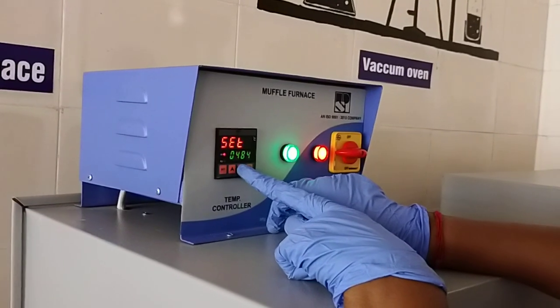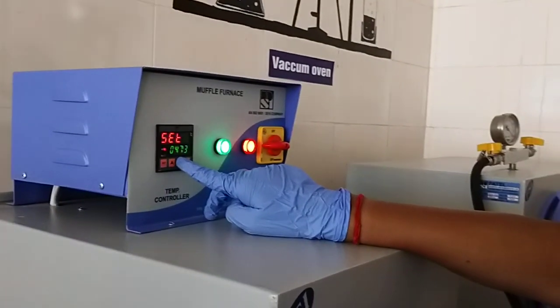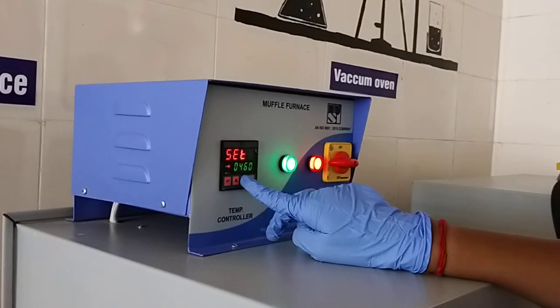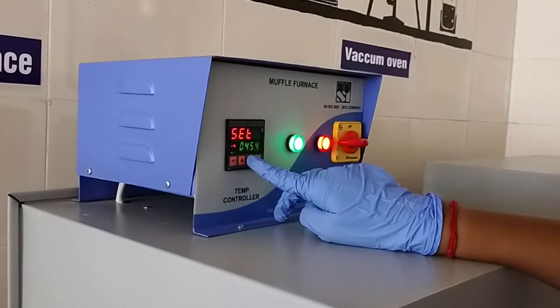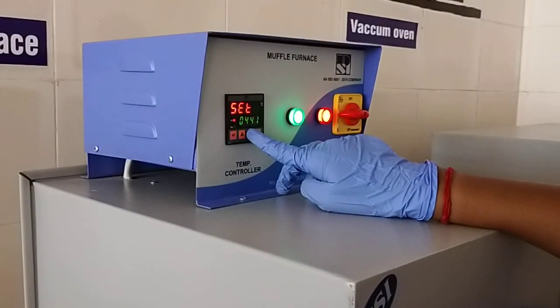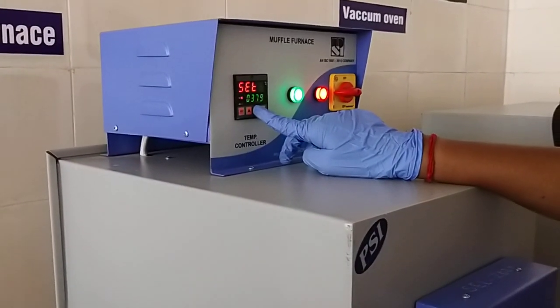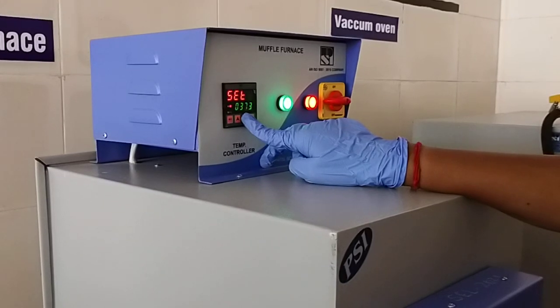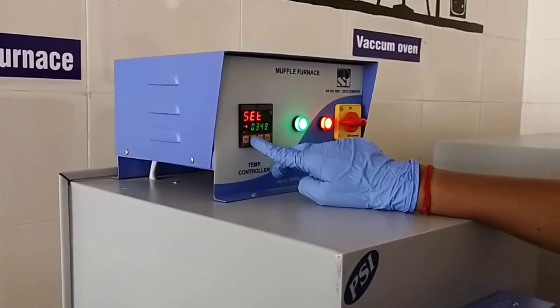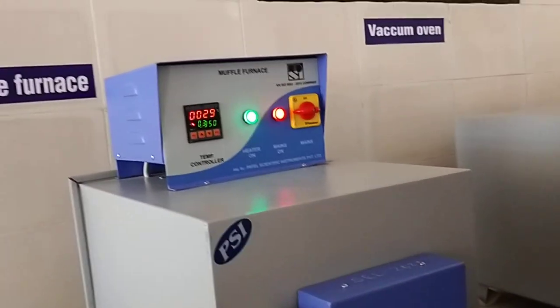Okay, the temperature will be set to 350 after a few minutes.